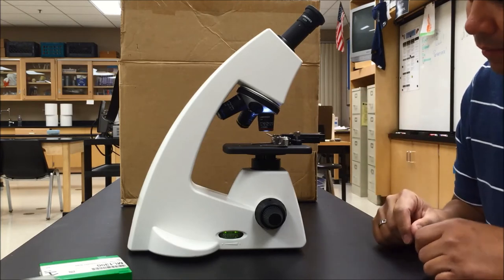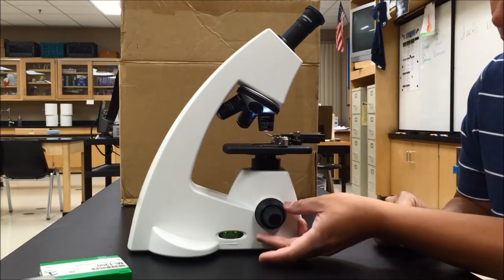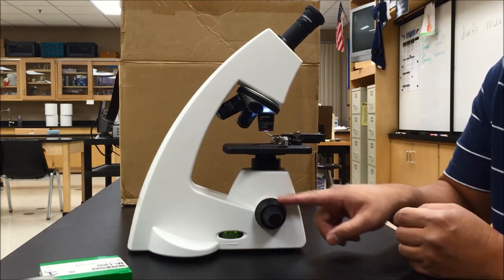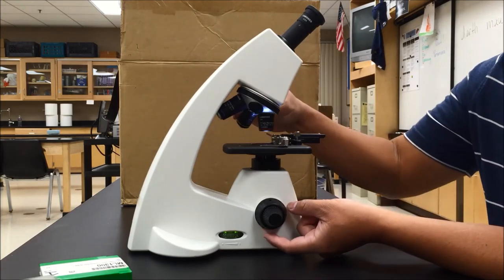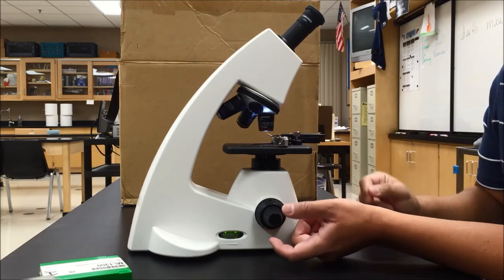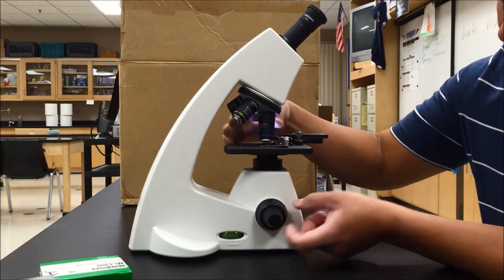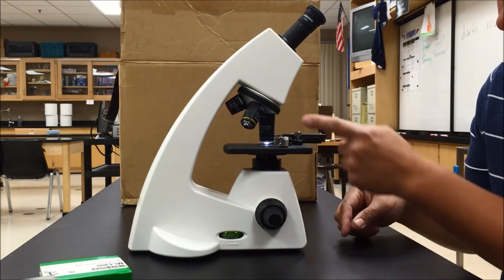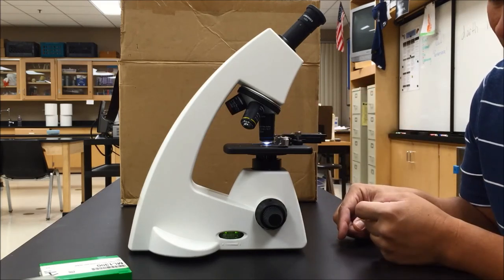Once you have a specimen in place on the stage — this structure right here — you can begin to use the two adjustment dials. The bigger dial is the coarse adjustment knob, which helps you focus under low and medium power. The fine adjustment knob is to only be used under high power. Never use the coarse adjustment knob under high power — you'll crack the lens and then you'll have to pay for it.